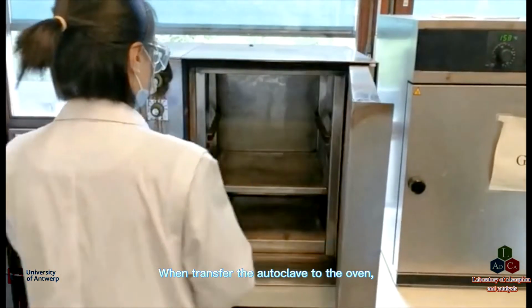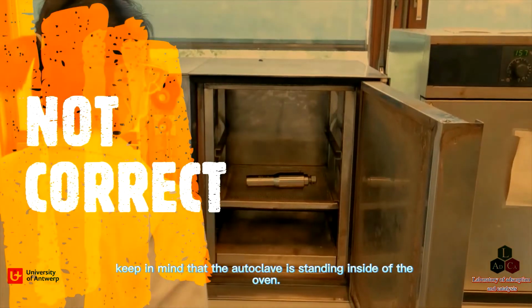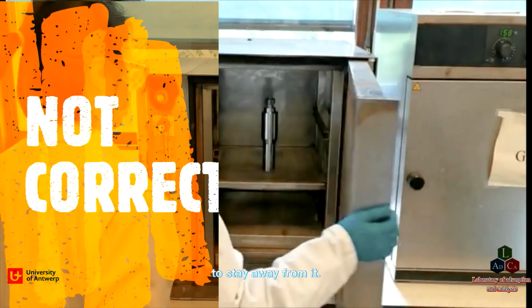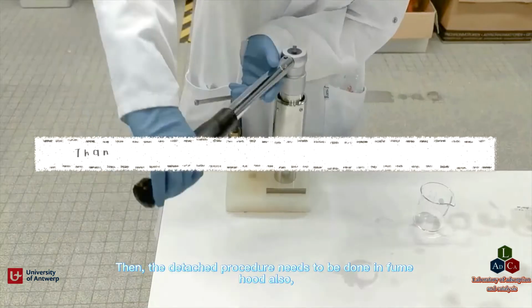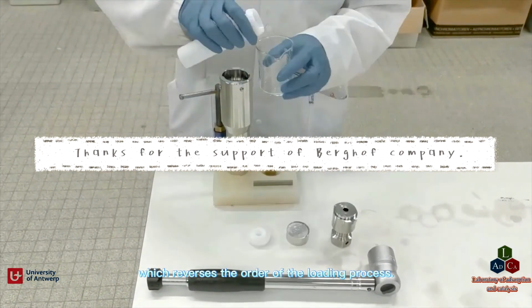When transferring the autoclave to the oven, keep in mind that the autoclave must be standing inside the oven. When the experiment is running, never open the oven, and remind other people to stay away from it. Only take the autoclave out when the oven cools down. Then the detaching procedure also needs to be done in the fume hood, reversing the order of the loading process.